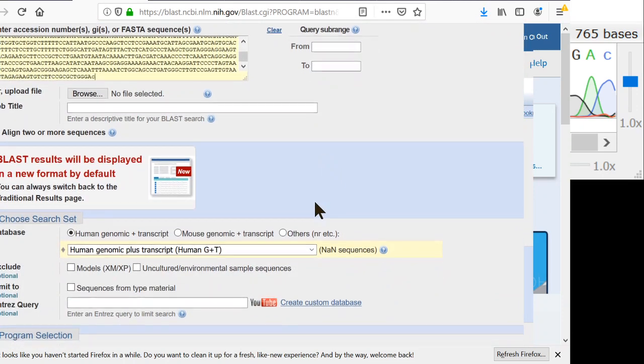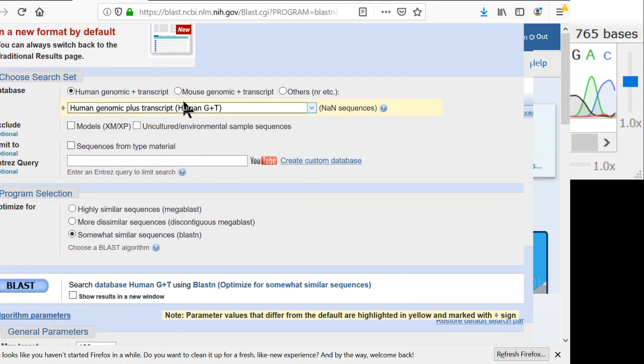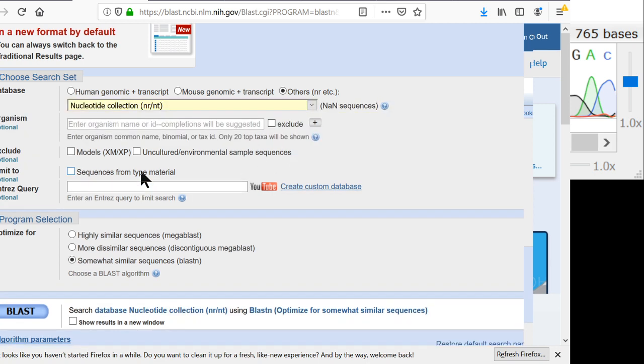Now looking here, these are the defaults on the BLAST parameters. You can see right now it wants to search the human genome. That's not good because our mushroom is definitely not a human. That's not going to work. So what we want to do is search the nucleotide collection. Searching the nucleotide collection, I'll search all of the mushrooms, all the plants, all the animals, every DNA sequence that's ever been uploaded to this nucleotide collection.